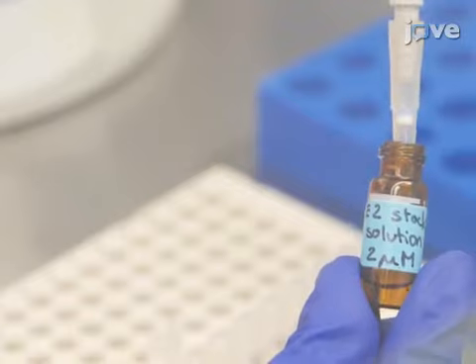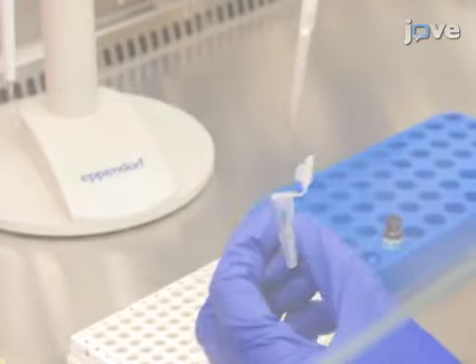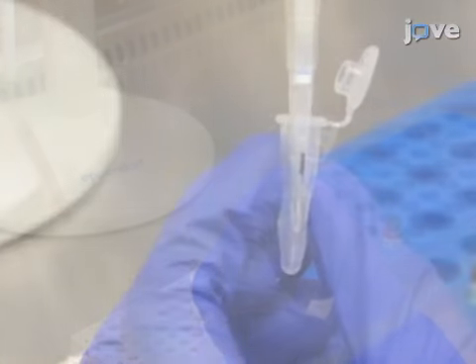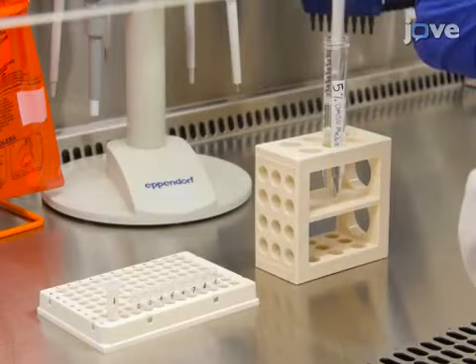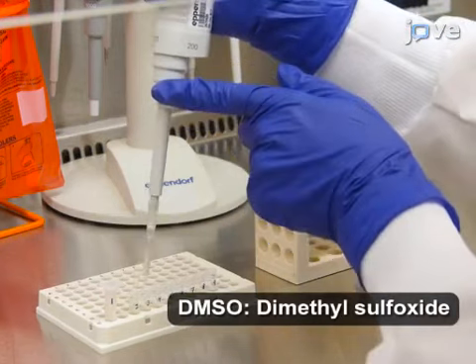Next, add 15 microliters of the appropriate reference chemical stock to 285 microliters of assay medium in a sterile tube. Mix the sample by pipetting up and down. Then, add 200 microliters of 5% DMSO in assay medium to 8 additional tubes.